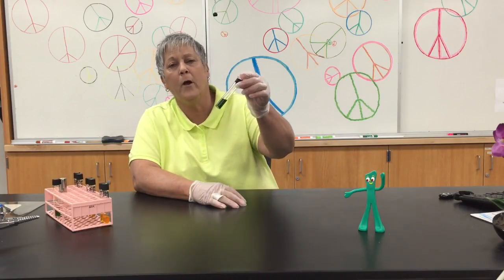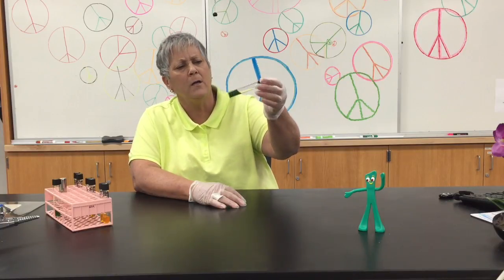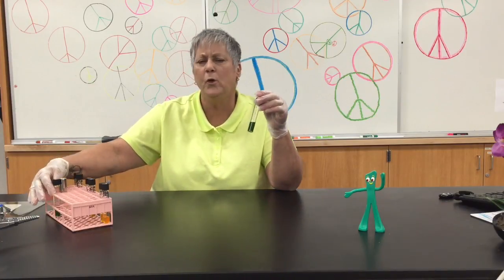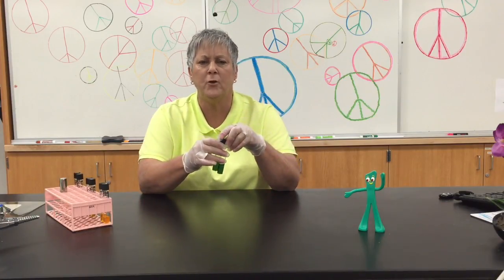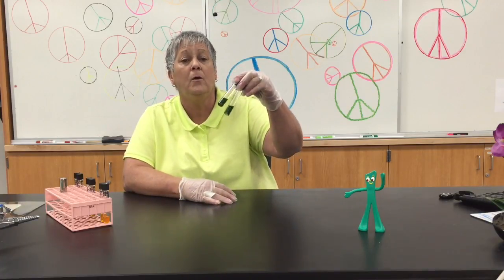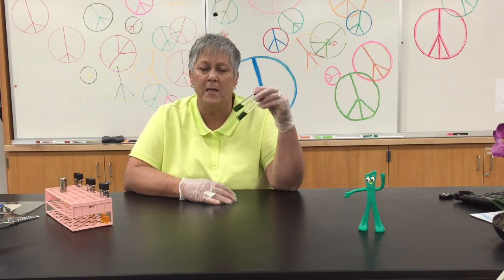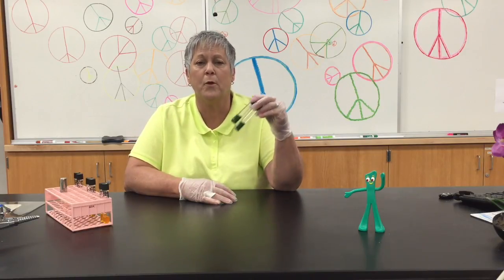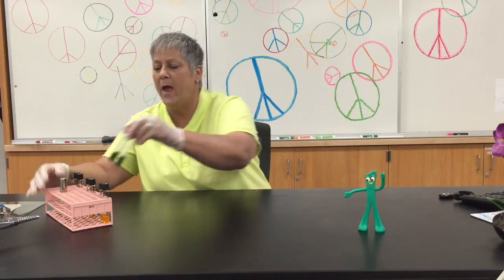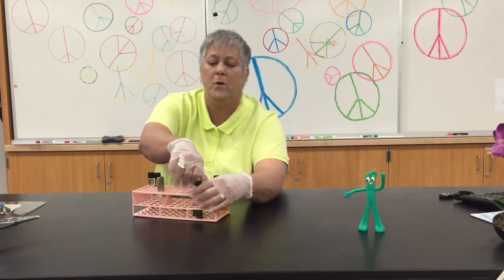Here's what it looks like prior to inoculation. It's a semi-solid media, so it's a little soft in that tube. And when you run this test, you would actually inoculate 2 tubes of OF basal media for each organism that we want to test. You would inoculate by using your needle to stab the organism into each of the 2 tubes. And once you've done that, you will add a layer of sterile mineral oil to one of the tubes.